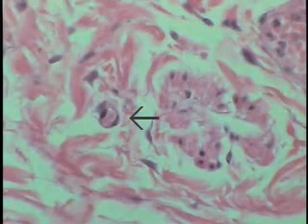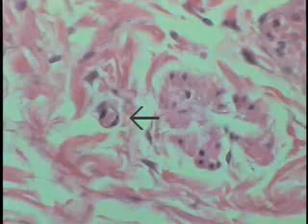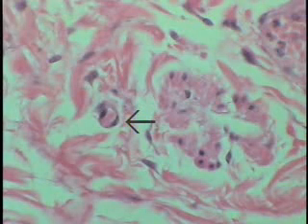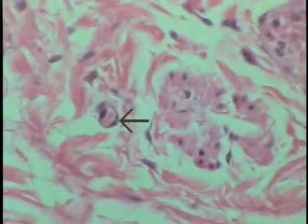Having completed an examination of the arterial tree, return to the gallbladder section and examine the adventitia of this particular organ, where the vessels are, for capillaries. A fairly decent example of a capillary is shown at the tip of the pointer at high magnification.